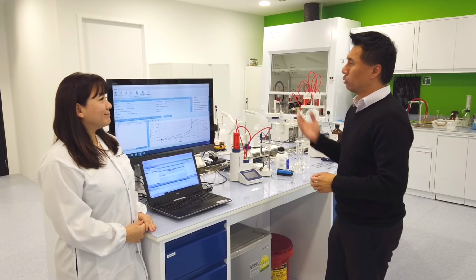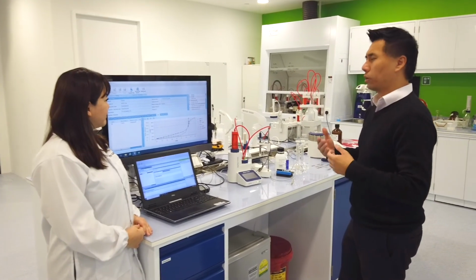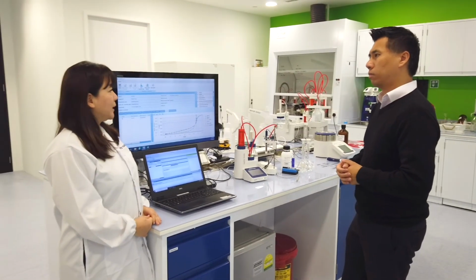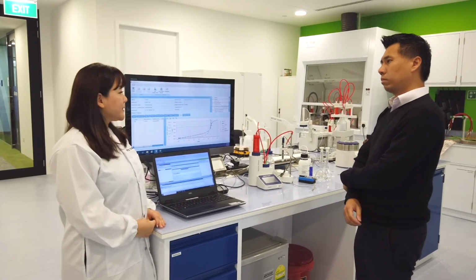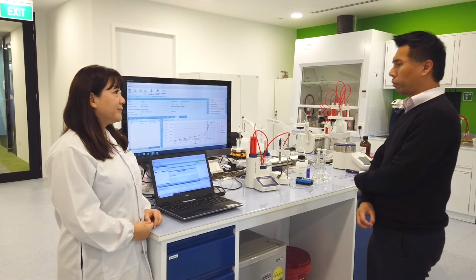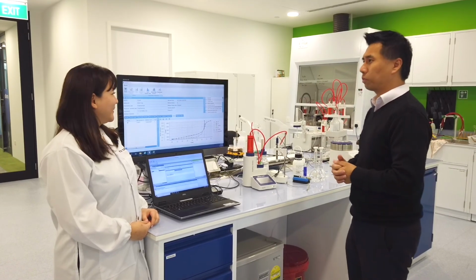Hi Rachel, thank you for sharing with me what LabX can do. I can see that the software is able to address all the issues and concerns that we are currently facing in our company. By the way, we also have other instruments in our laboratory. Are we able to connect them to the LabX software as well? Yeah, sure. So you can connect up to 16 METTLER TOLEDO instruments such as pH, balance, melting point, UV/VIS, then also what you have seen here, general titration as well as Karl Fischer. Okay, great. We'll look into connecting them to the LabX software. Sure. Thank you. You're most welcome.